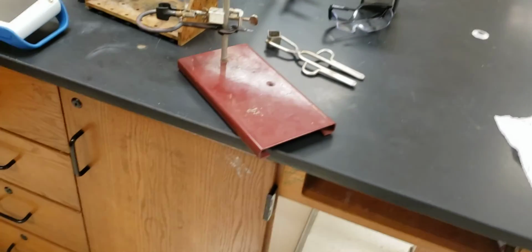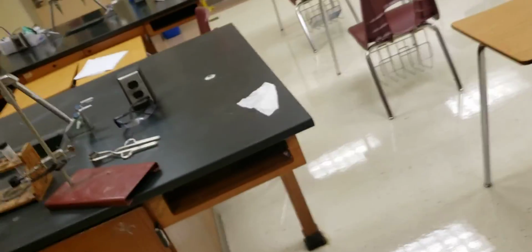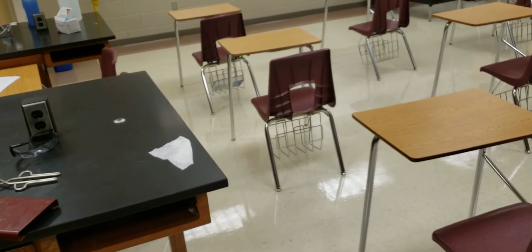At this point, I'm going to close this down for this lab here. And you should be able to use the data that is going to be provided for you in the lab report in order to finish your lab.